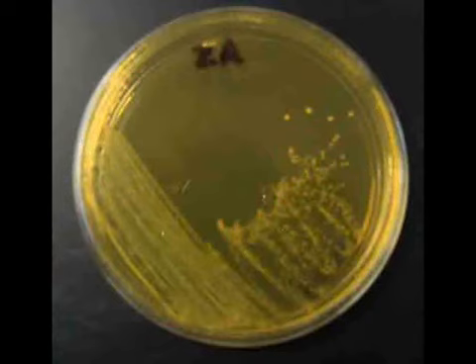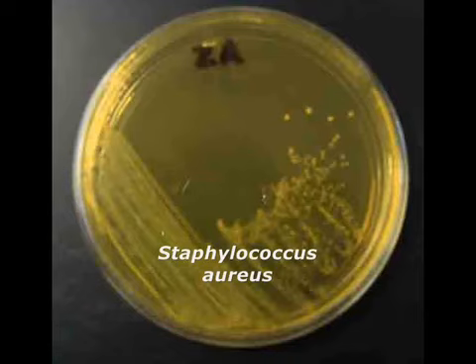On this plate, we also see the growth of halophiles, but in this case, the bacteria triggered the pH-sensitive dye to change color. That means that we have mannitol fermenters, Staphylococcus aureus, a pathogen.